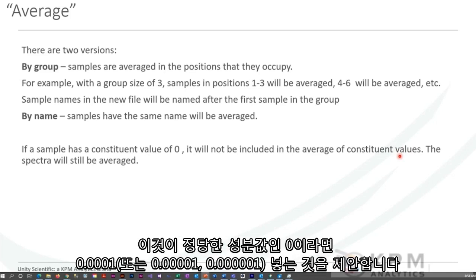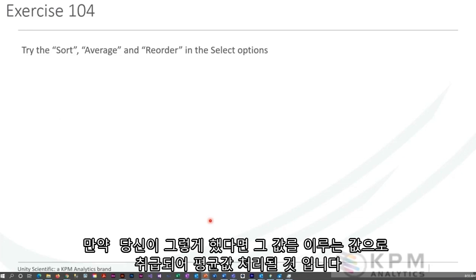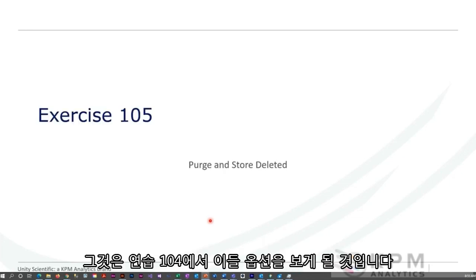So if this is a legitimate constituent value of 0, if you remember, I suggested that you put in 0.0001 or 4 zeros or 5 zeros and a 1. If you do that, UCAL4 treats that value as a legitimate value and it will be averaged. Okay, jump into exercise 104 and you will see those options.